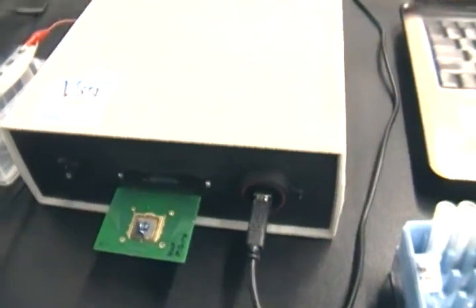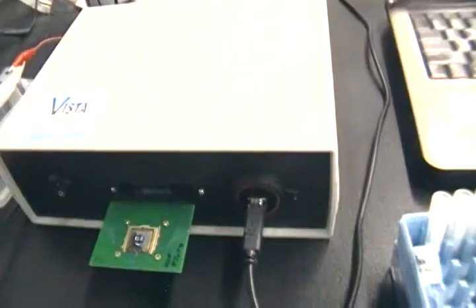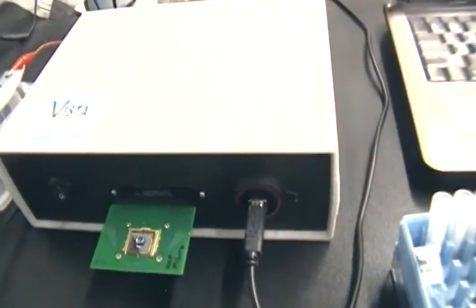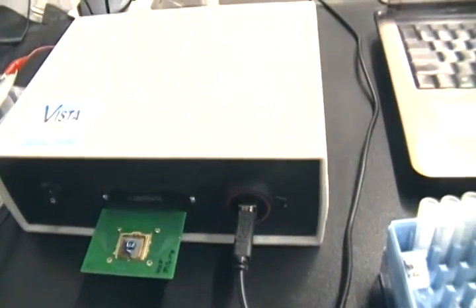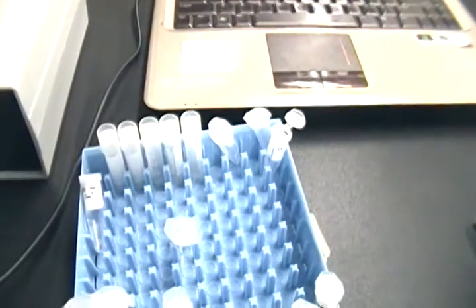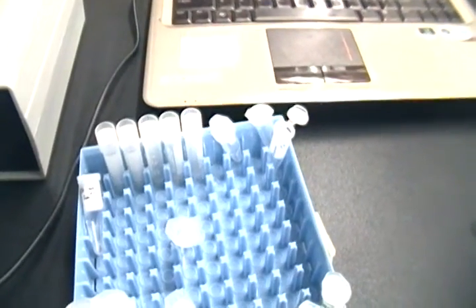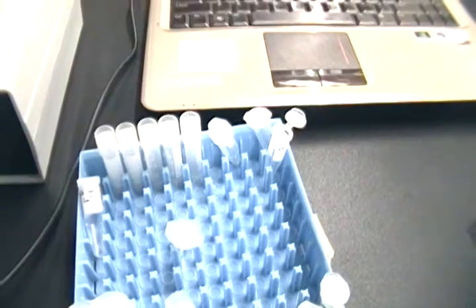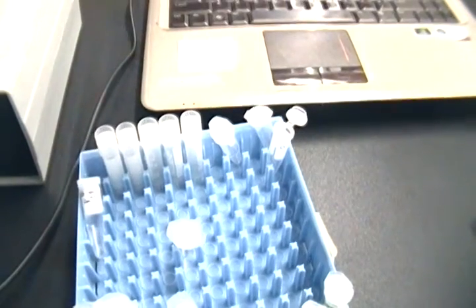Since it is working right now, let's just do the acid test. And I'm going to add a small volume of fibronectin, 70, excuse me, fibronectin. I'm trying to adjust the pipette. You can't see over here. Here's the pipette. I'm going to add 20 microliters of three picograms per mil of fibronectin in the same buffer.